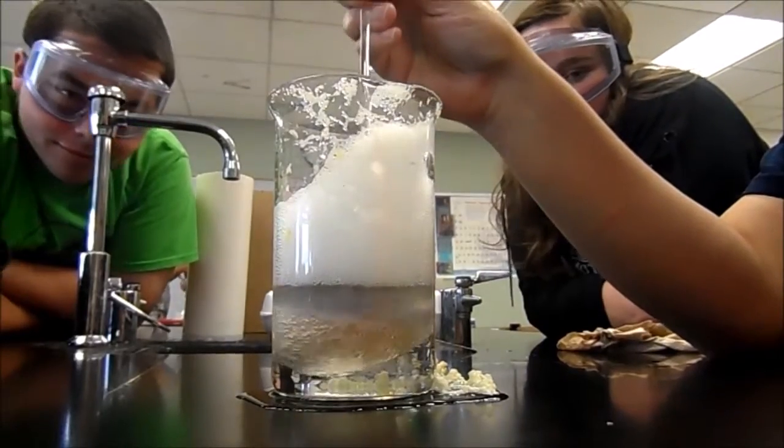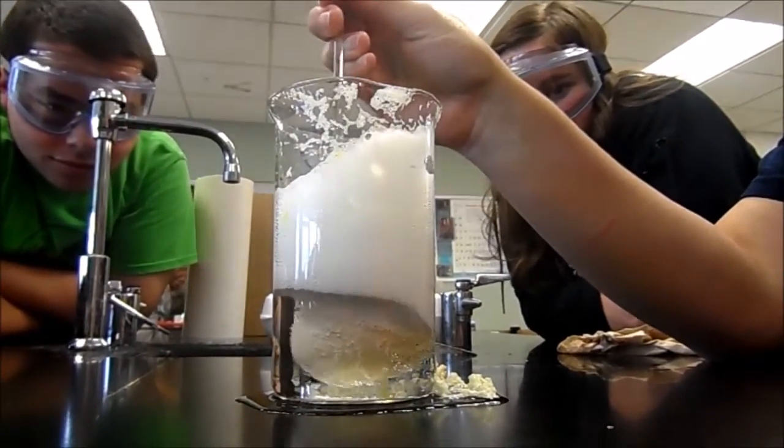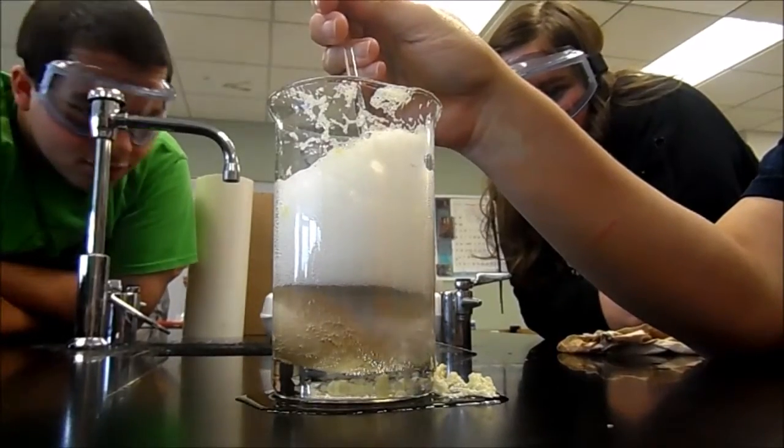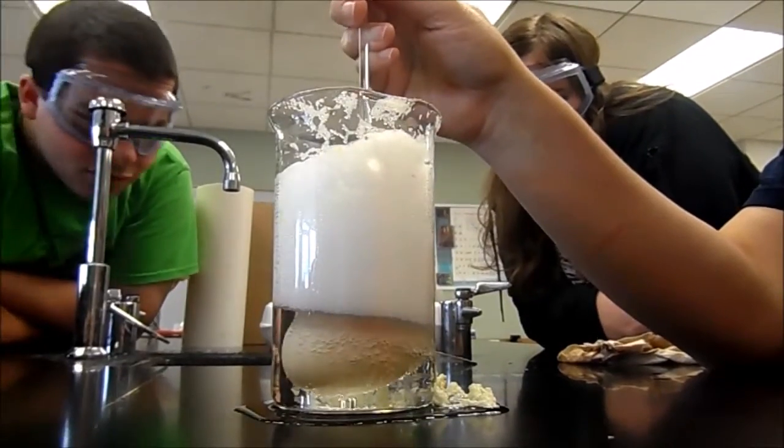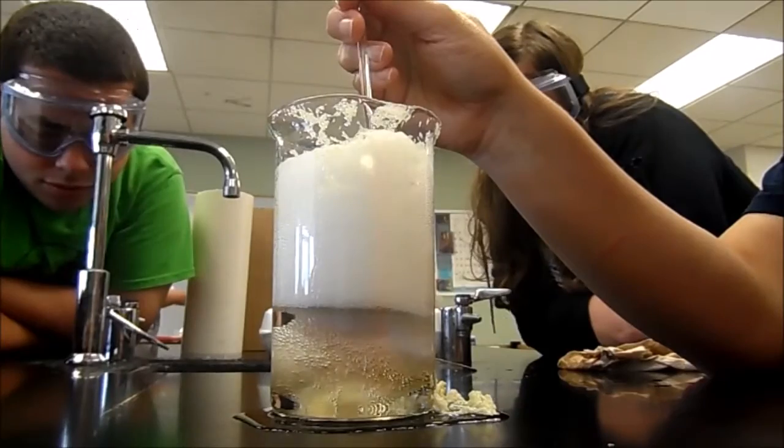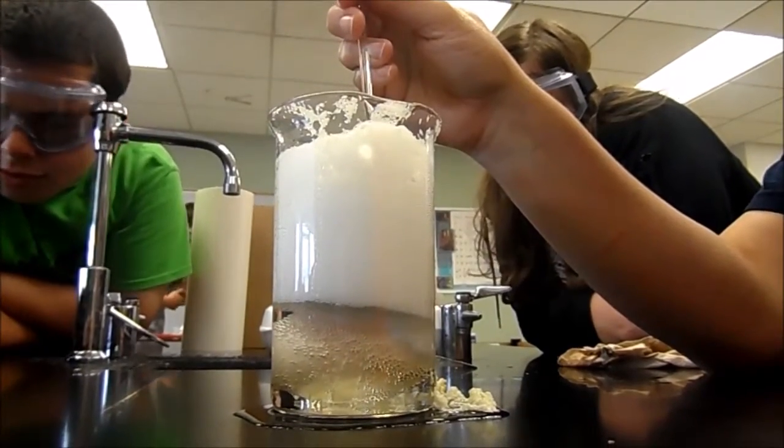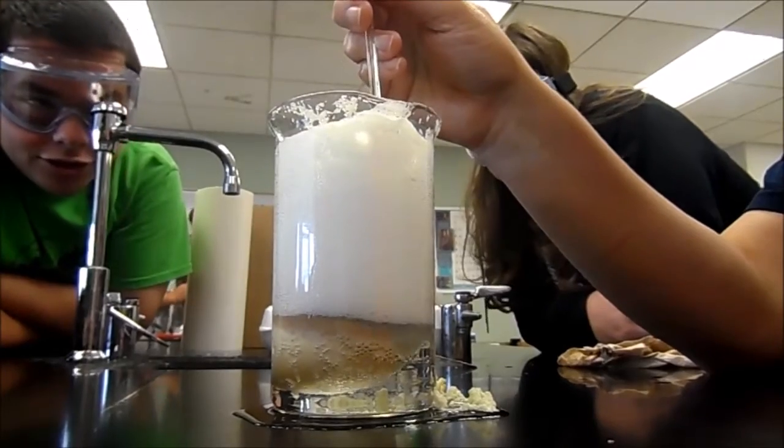I feel like it didn't get that entire side. Well, when it floats up to the top, the shell will go to the top and so it's not in the acid. So you have to kind of hold it down. What would happen if you did this with a live chicken egg, like one that had just hatched?